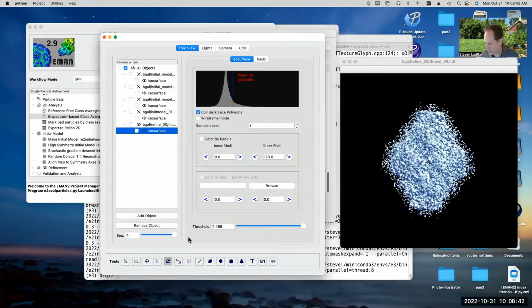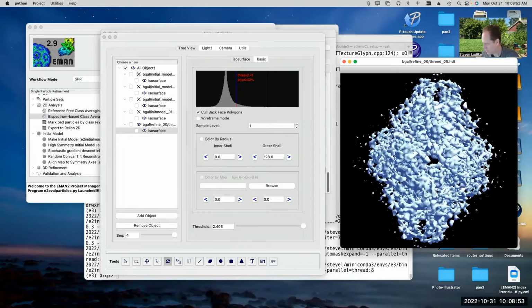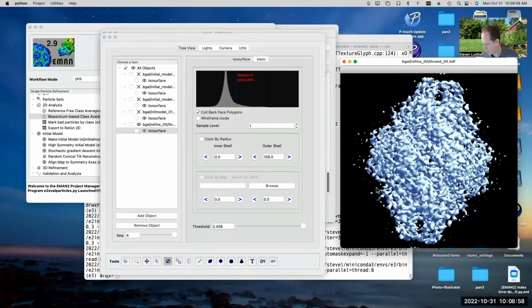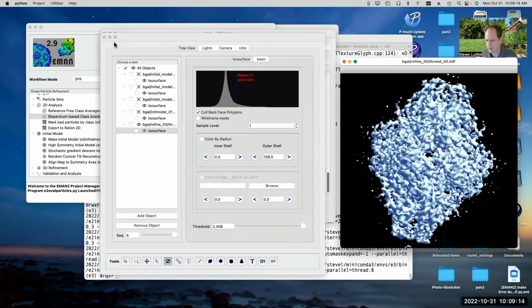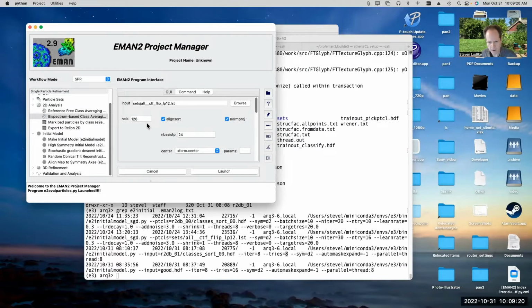And again, I've still got all the other ones that I've done in here. Let's raise the isosurface threshold a little bit. And you can see that this actually refined to pretty decent resolution. A lot of those details you see there, those are actually real. Now there is a little noise outside the structure, but this quick refinement I ran, as I said, was targeting a little bit better resolution than the refinement that it tells you to start with in the tutorial. Actually, let's take a look at that. Let me close all these windows just so we're starting from scratch here.